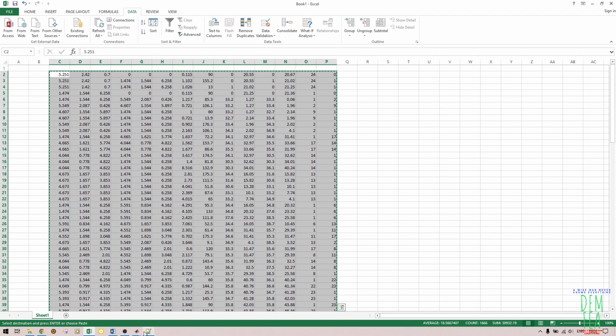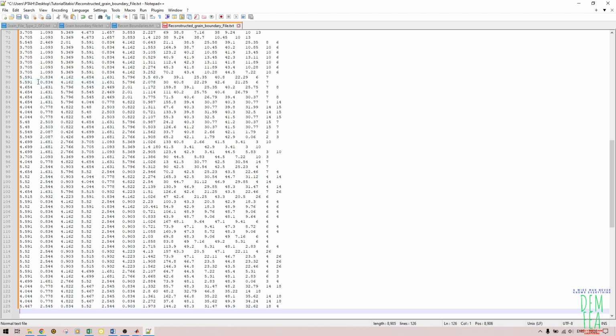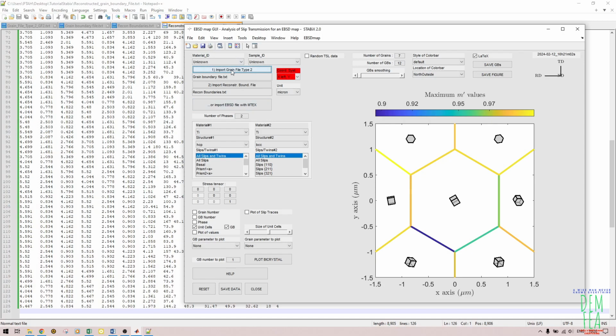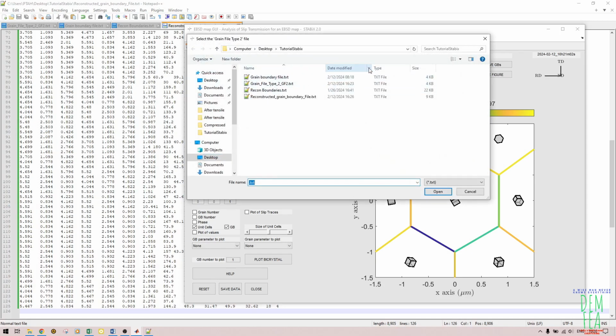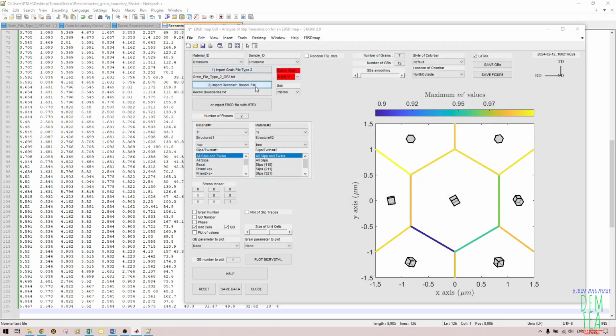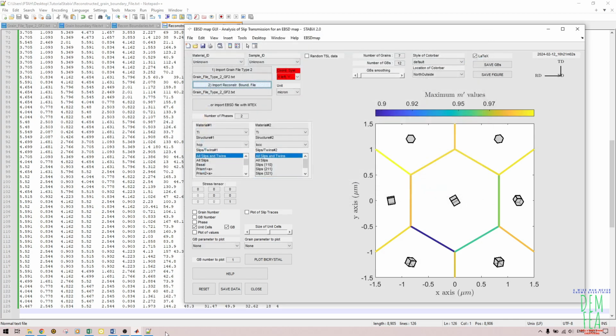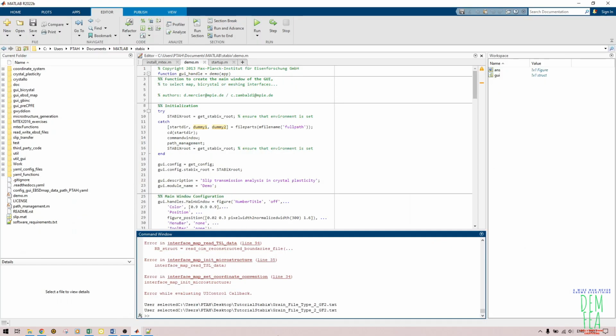Now after copying this, we need to come and paste them on another file. It's not a good idea to interfere with your original file. So we just come here and we paste like that. Once we paste, we control save, and now we try to import these files again. So we come import. Now the ones that we have worked on, we organize by date modified like that, and then we want to see if we'll get any other error. So we need to go back to our MATLAB window like that.